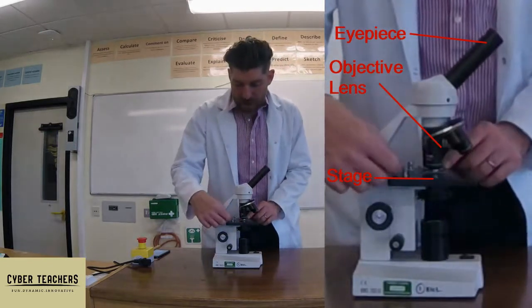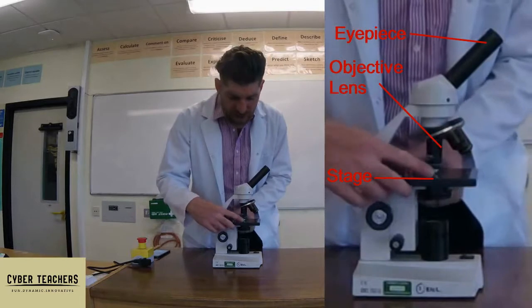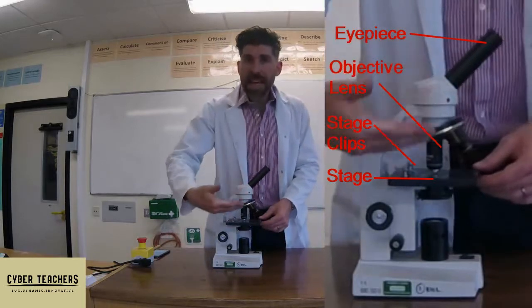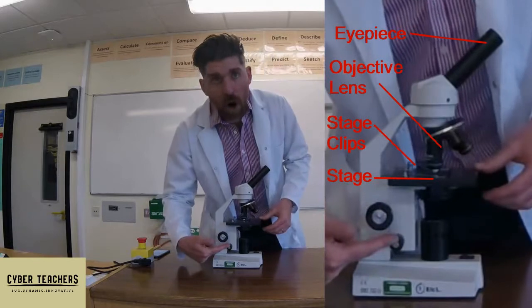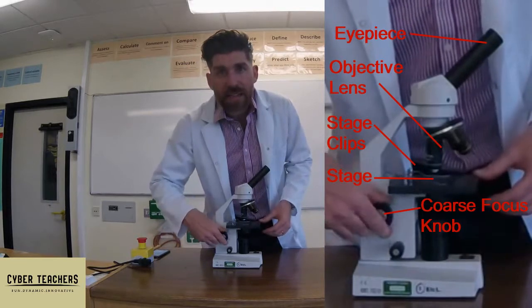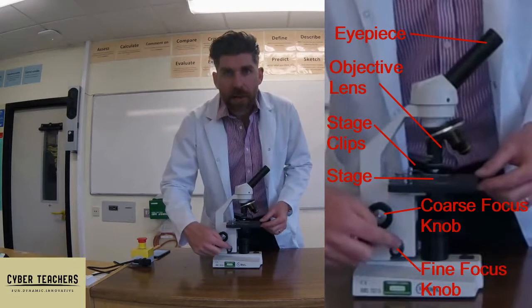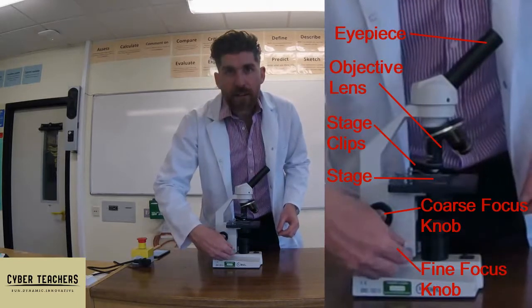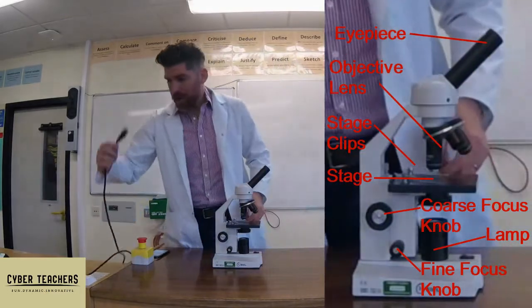The stage is where you put the slide — the thing that you want to look at — and it's got two clips which can secure a slide in position. To focus the microscope, you need to move the stage up and down using two adjusting knobs. The big one is the coarse adjusting knob, which moves the stage up and down significantly. The small one is the fine adjusting knob — you can turn it a lot and barely perceive the stage moving, for very careful movements at high magnification.